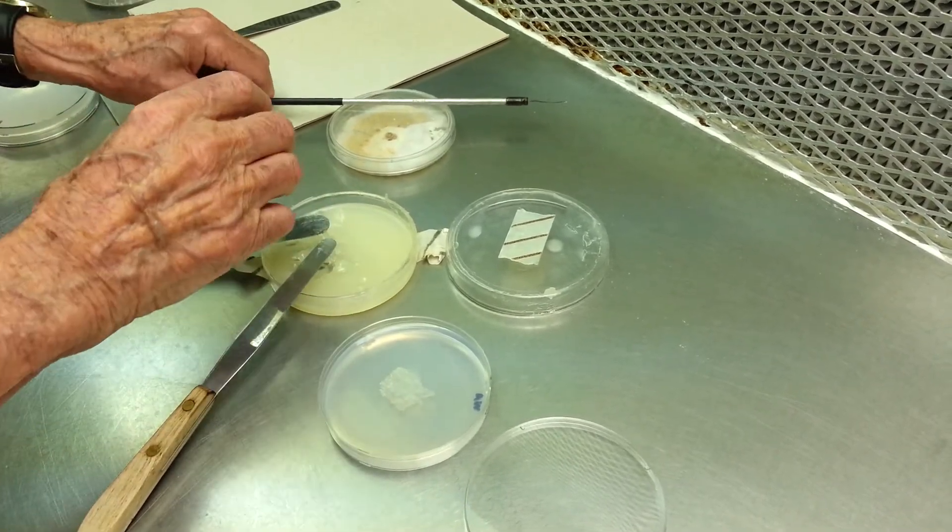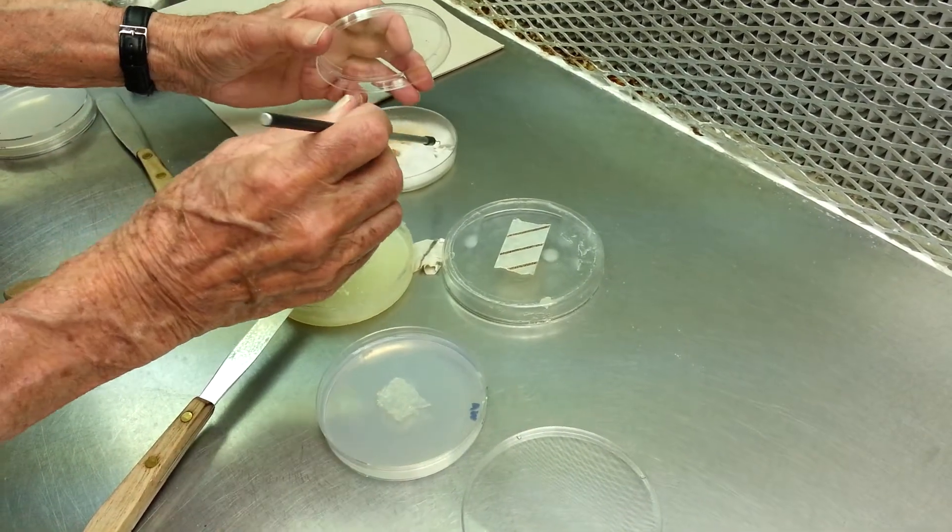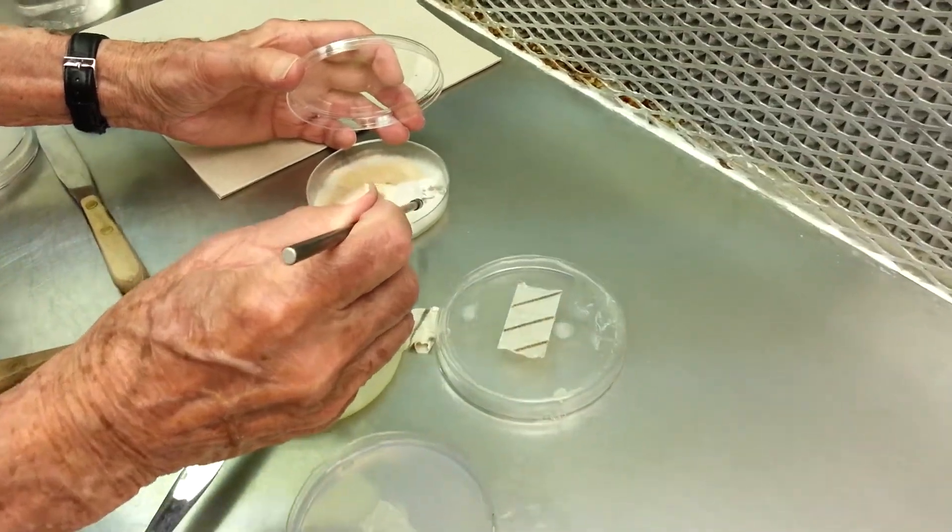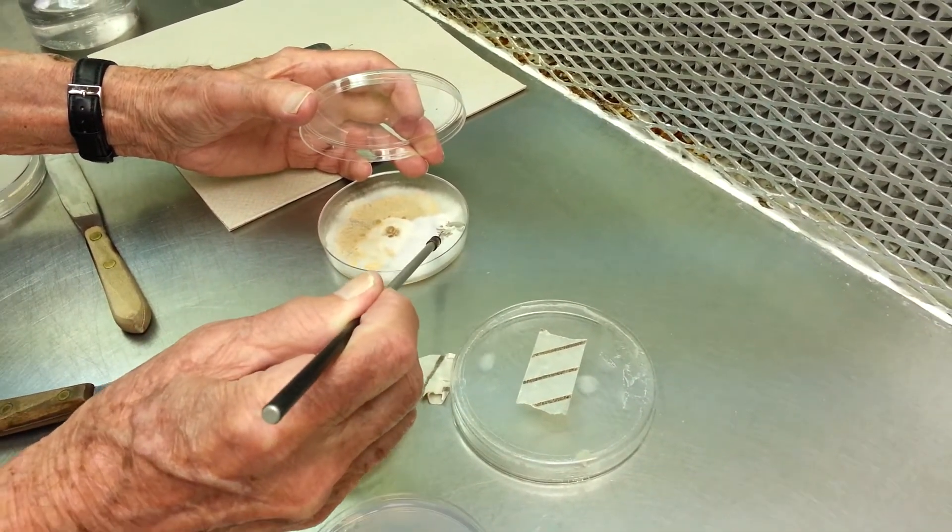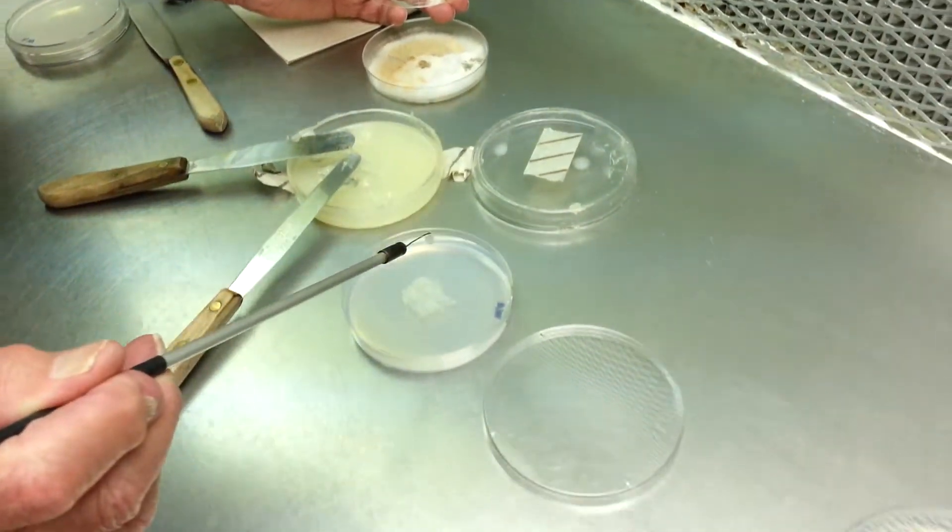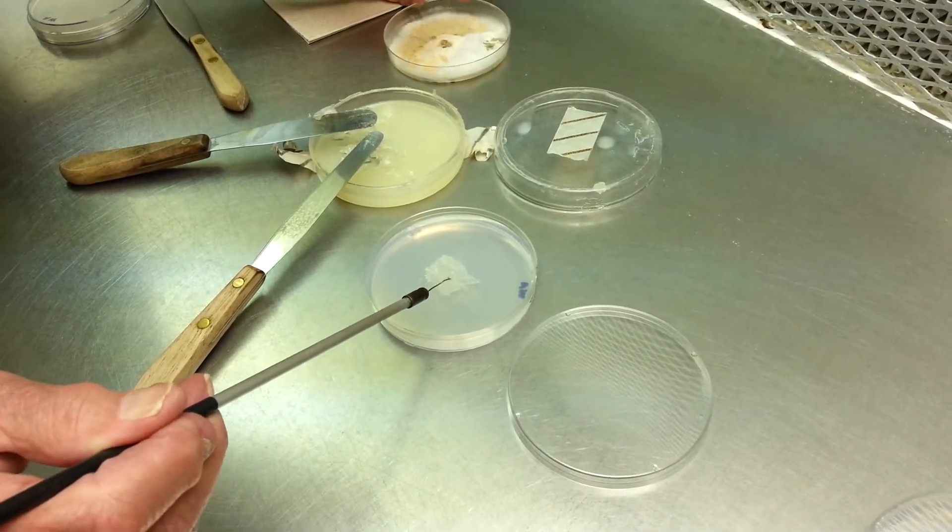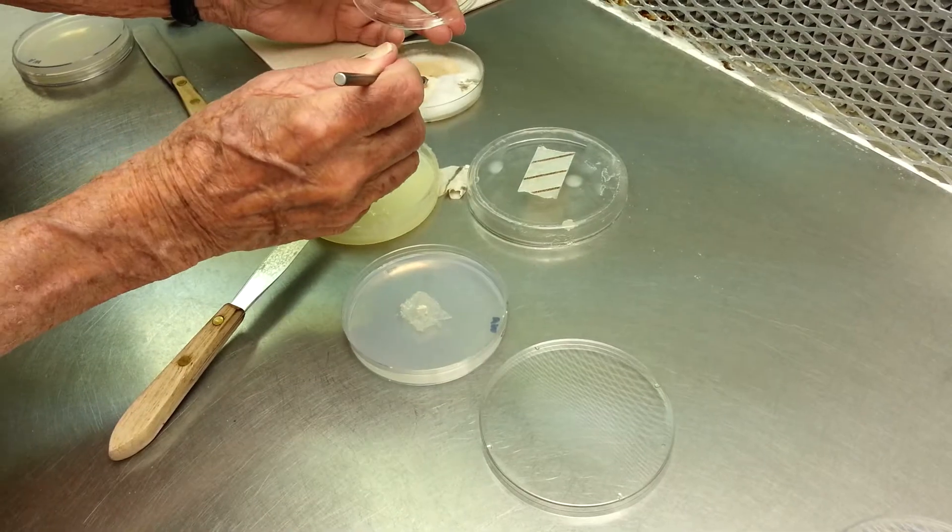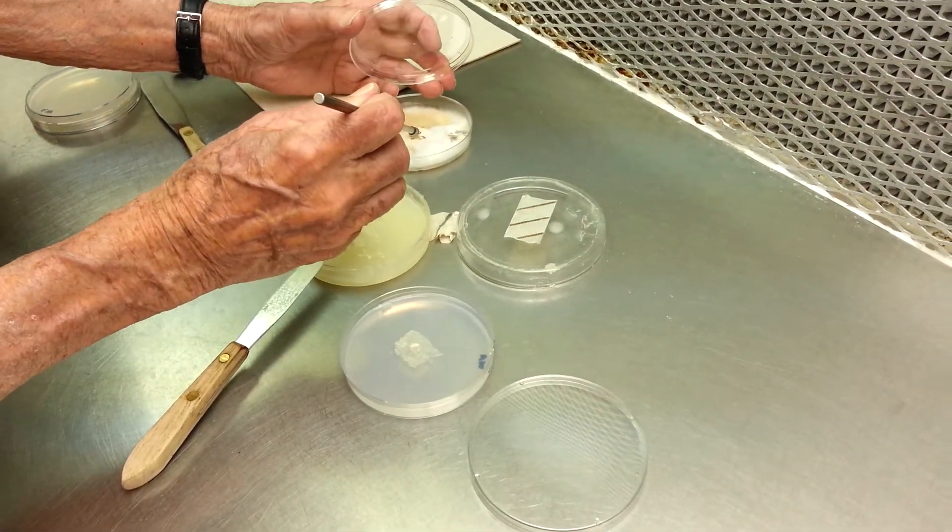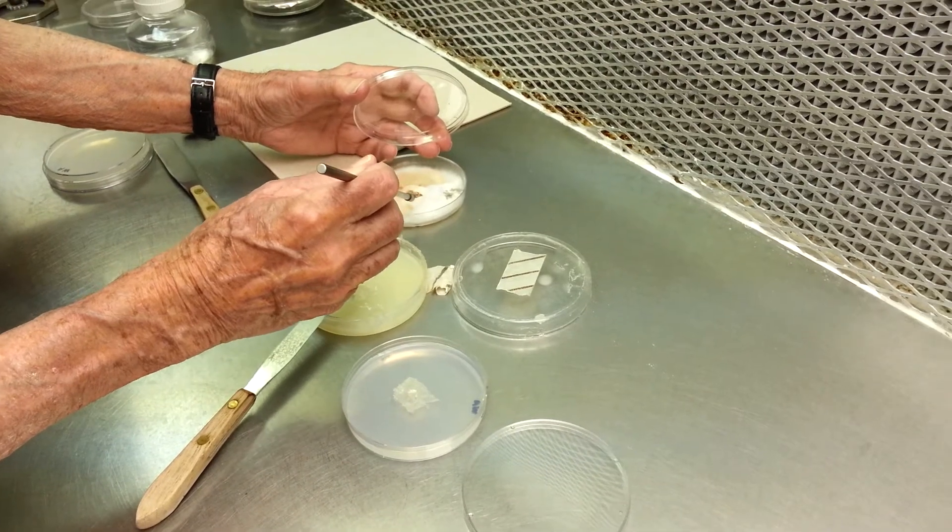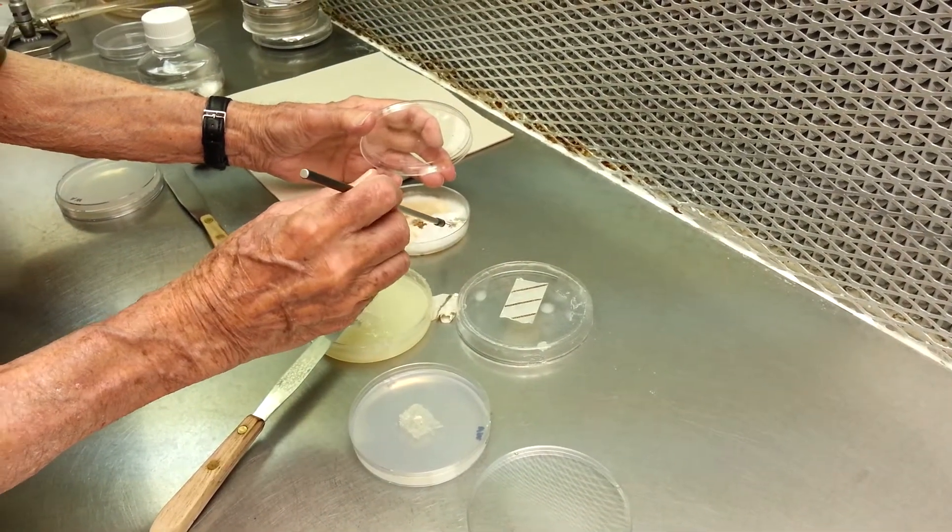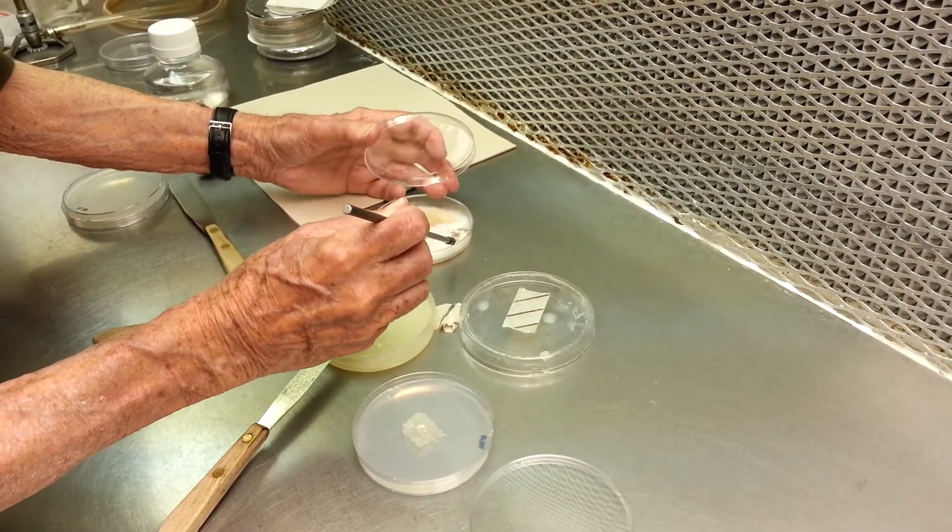And then, we take a piece of the contaminated fungal culture, and put it in the middle. Inside out, outside down, or... Does it make any difference? From any part. Okay.